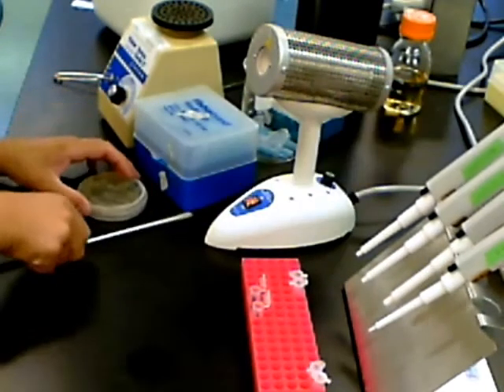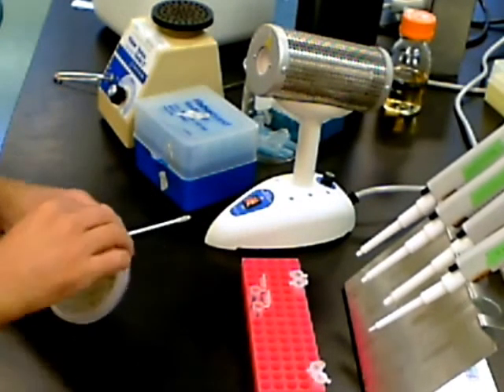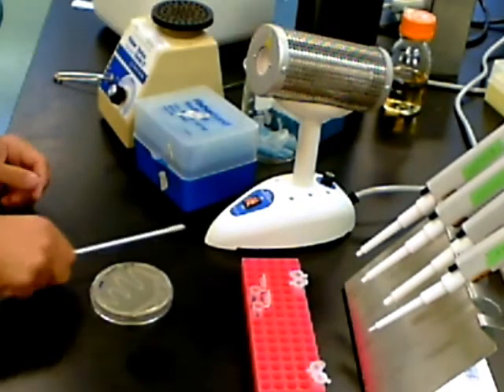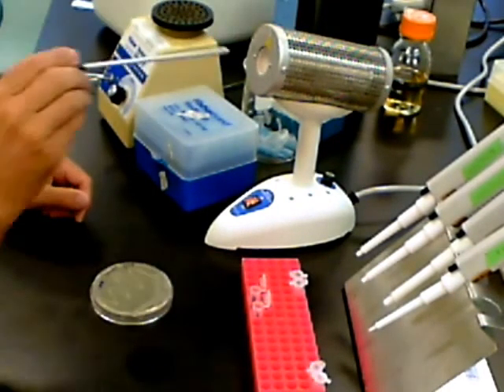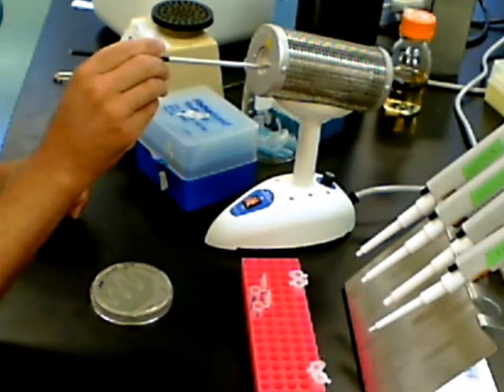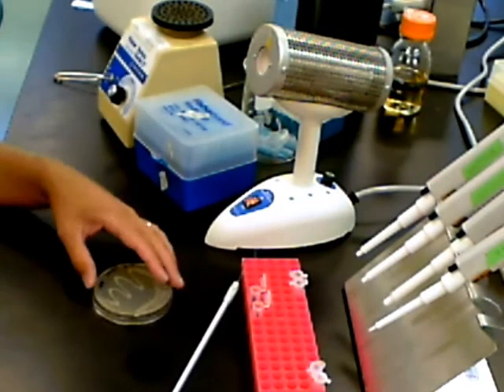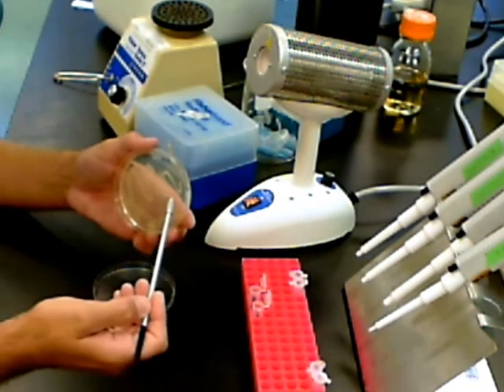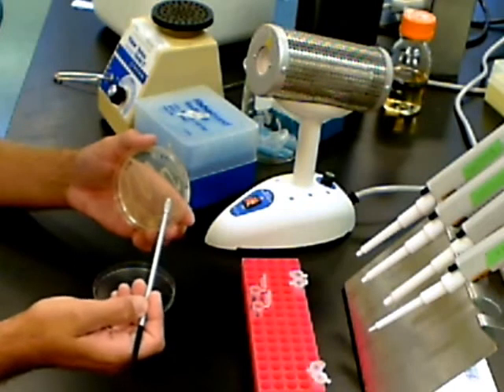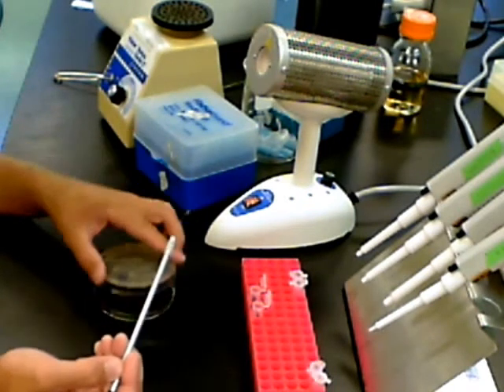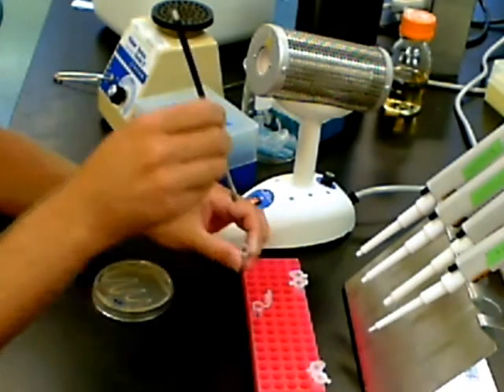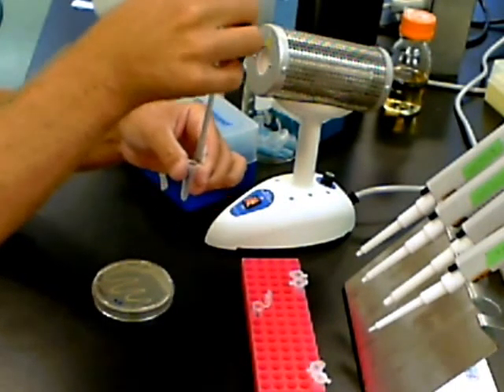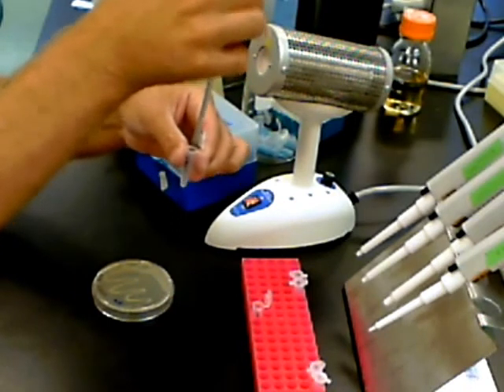From the source plate, we want to pick two, or three, or maybe four colonies of bacteria and add them to the Eppendorf tubes. Because the bacteria will stick to the inoculating loop, you'll need to twist it vigorously, and you may want to shake it up and down in the solution to dislodge the cells that are stuck to the end of the loop.